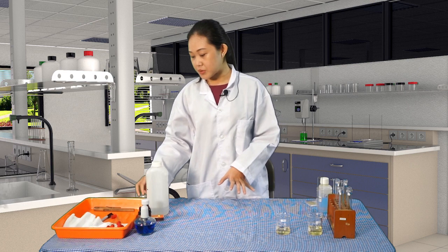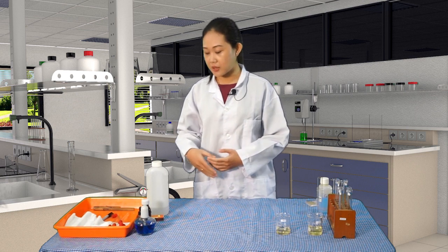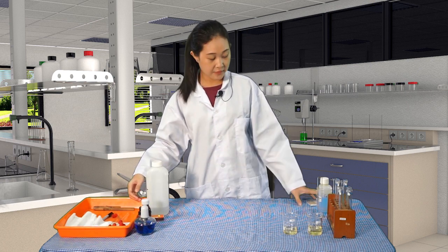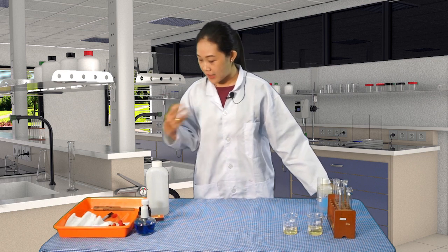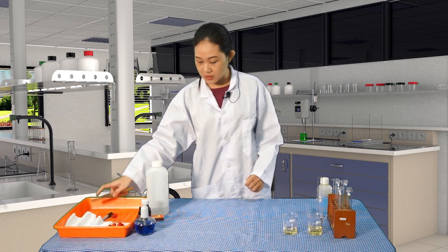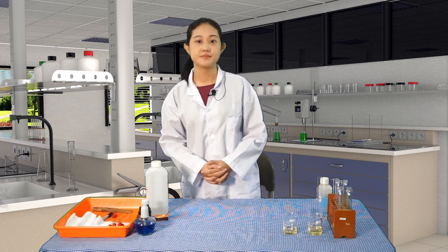The other one is the physical characteristics, where we are going to see the color of the urine, and we are going to smell the odor, and check the pH using this pH paper. And for the rest of the materials that will support this, of course, we need the pipettes, the test tube holder, and the match, and I think that's all.